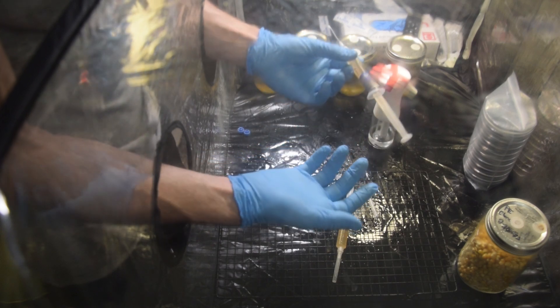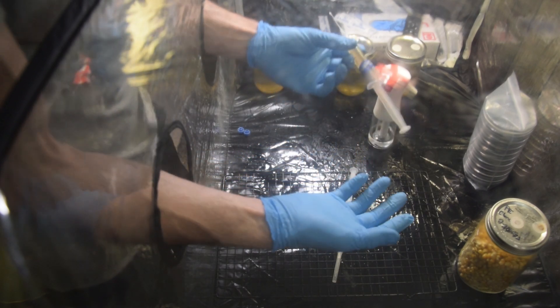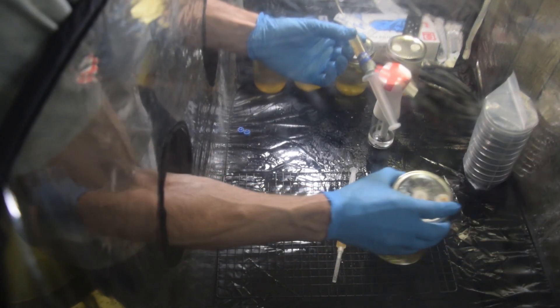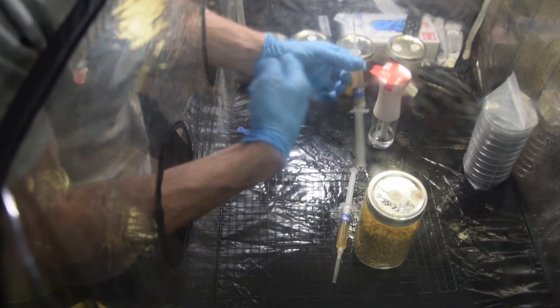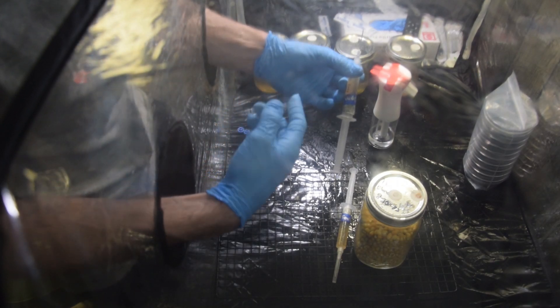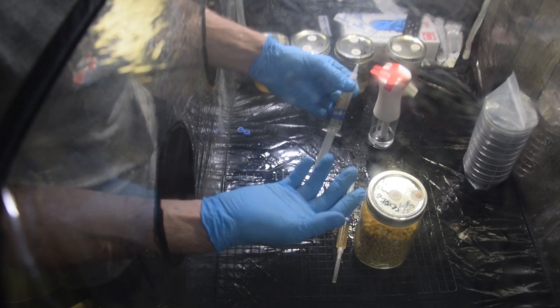I don't know if it does much for me, but I do like to use lion's mane supplement, and why not grow and make your own? I have the needle on this syringe because I'm also making some liquid cultures, which I'll be doing next. I already have the needle on here just to make it easy — you don't need it for this.